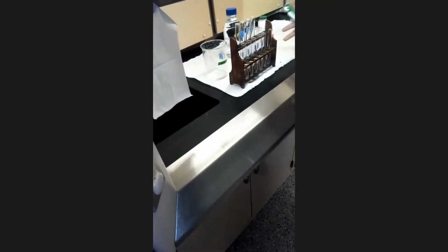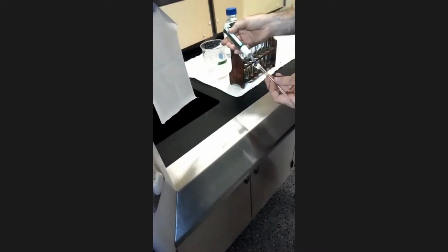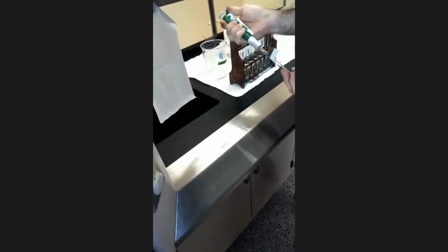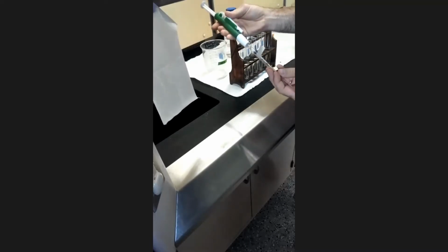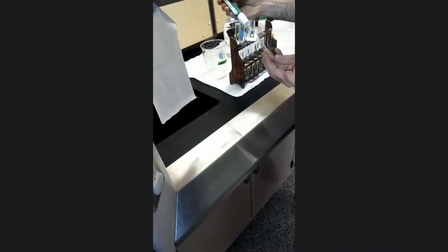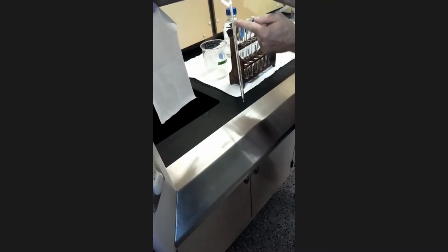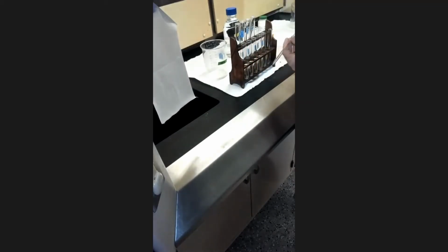So here I have my test tube rack, and here I have the pipette that I'm going to use. You may have used these pipettes before. You can use your thumb on this scroll wheel here to pull fluid up into the pipette, okay? And then you can use this lever on the side to push and release the fluid down into the test tube. As you can see here, there are graduations on the side of the pipette here, which will give me a sense of how much volume I've actually gotten, okay? So without further ado, I'm going to move some buffer into my tubes.